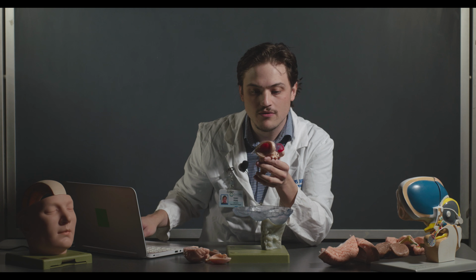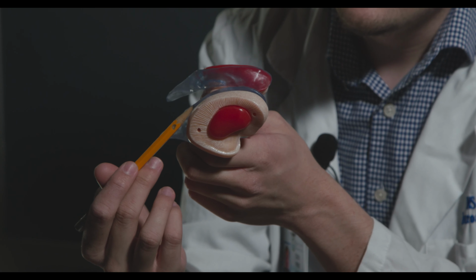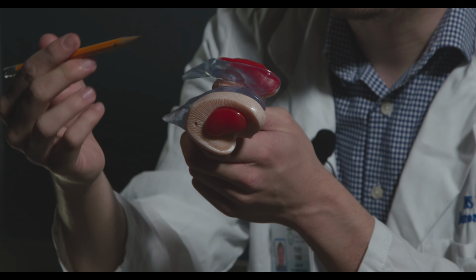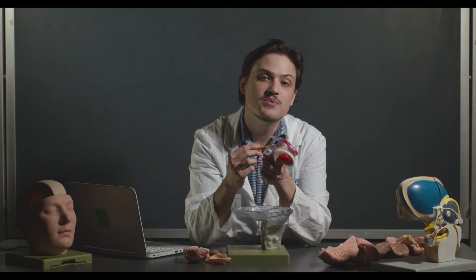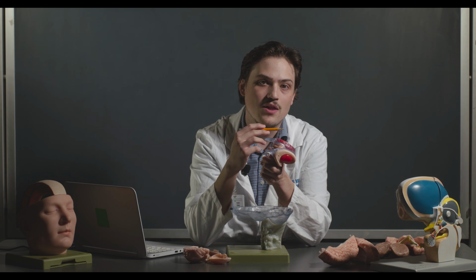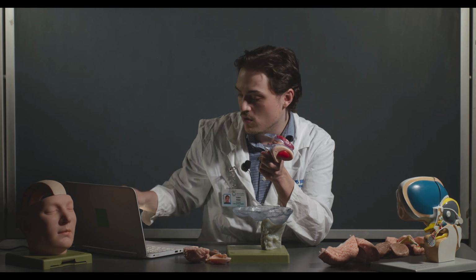Another thing to keep in mind about the internal capsule, I mentioned it a little bit earlier. These are the fibers that are essentially going to and from the cortex. So this would come out into the corona radiata and connect with the cerebral cortex itself. But essentially, it's just containing the ascending and descending fibers that need to communicate with it. There are stops with the actual thalamus in the internal capsule. So some of these fibers come up, synapse in one of the nuclei of the thalamus, and then it gets relayed from the thalamus out through the internal capsule to the cortex.